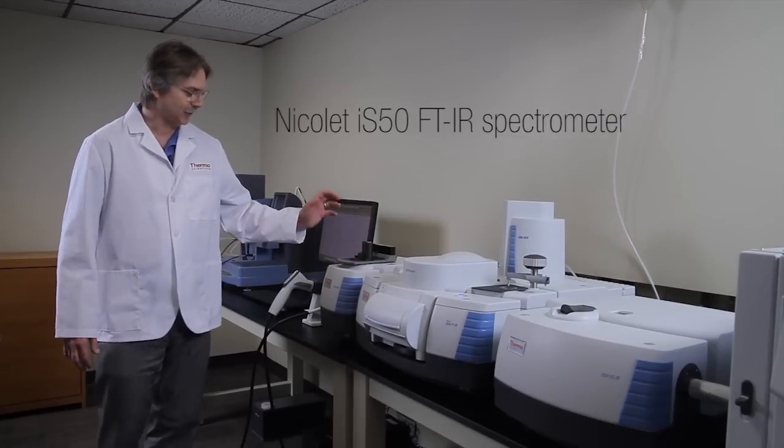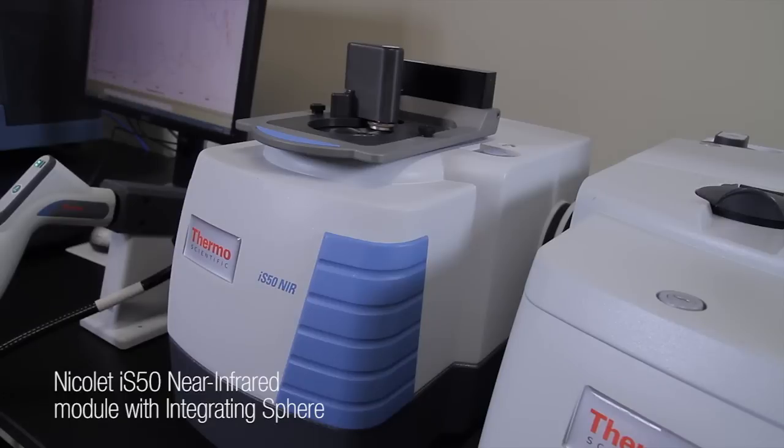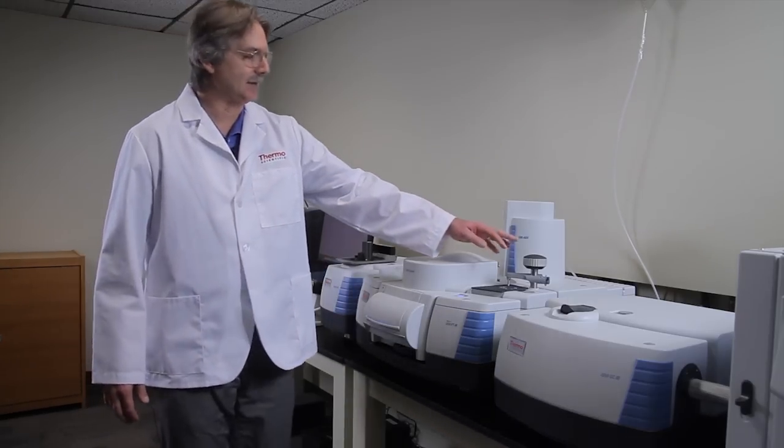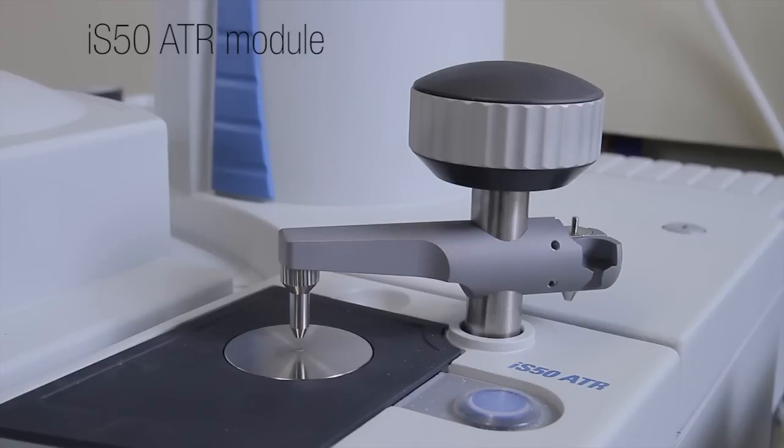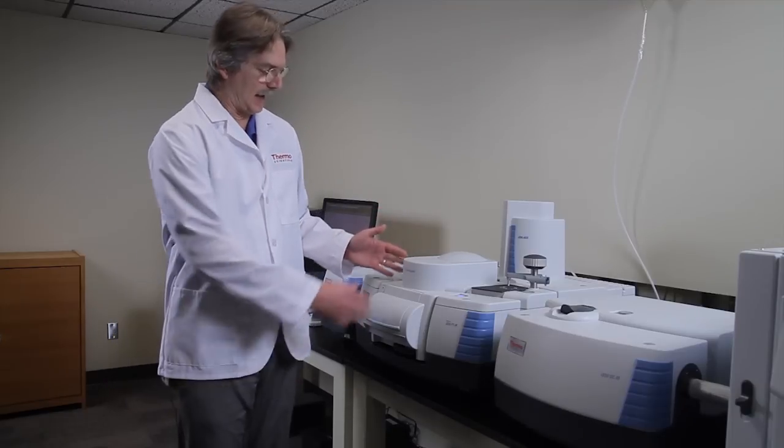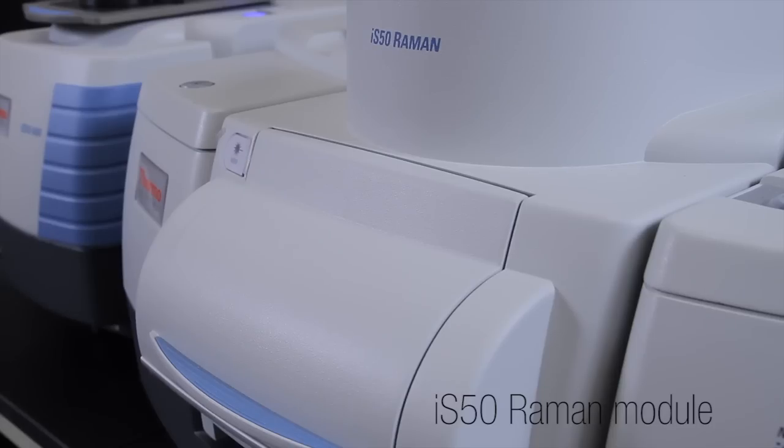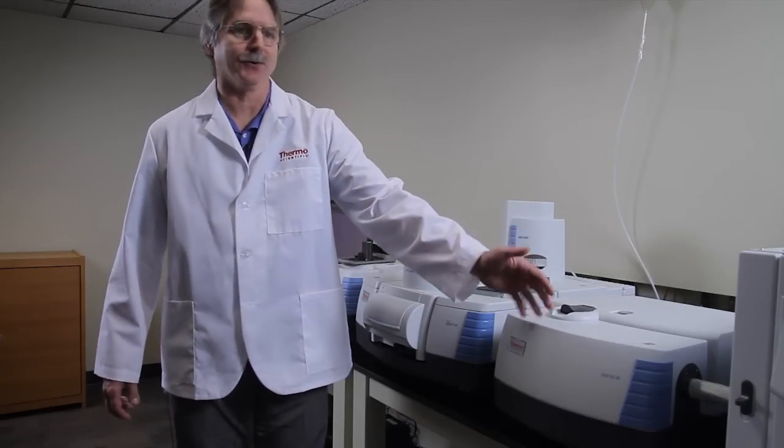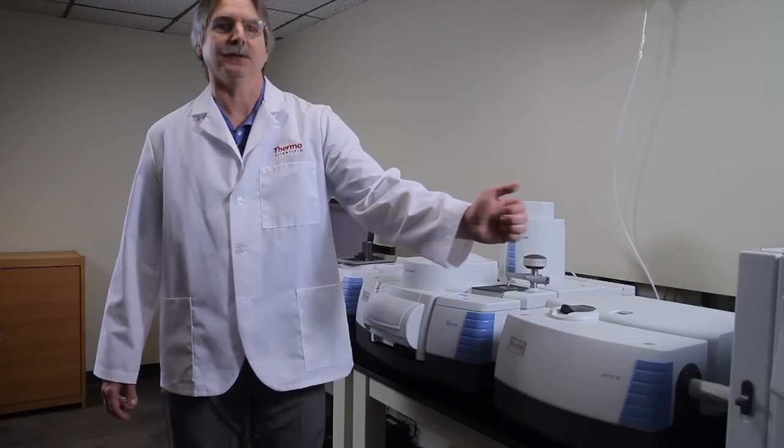It has attached to it the near-infrared modules, which can do in the near-infrared region. We also have an ATR attachment, which can go into the mid and the far-infrared region. We have a Raman module attached to the accessory compartment. And then finally, we can have other modules, for example, this GC equipment attached here.